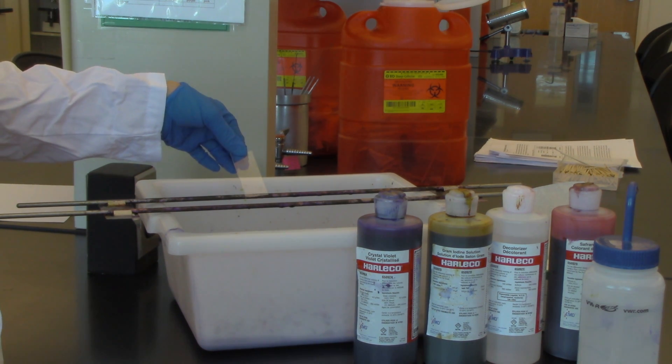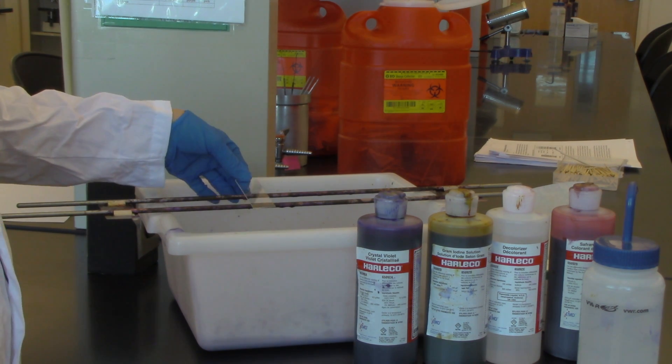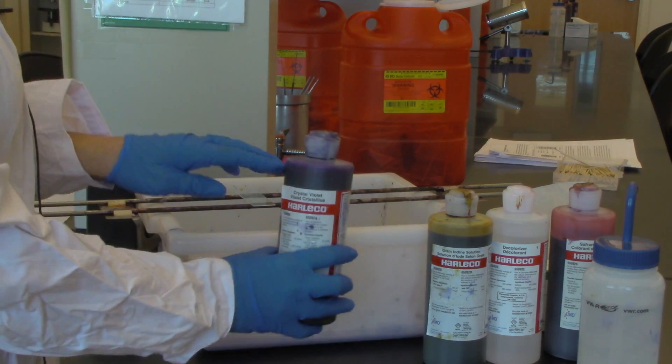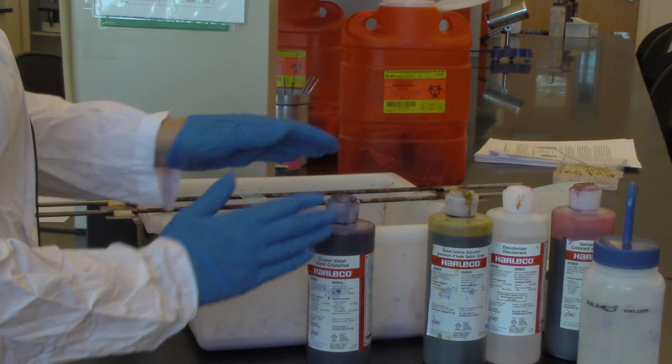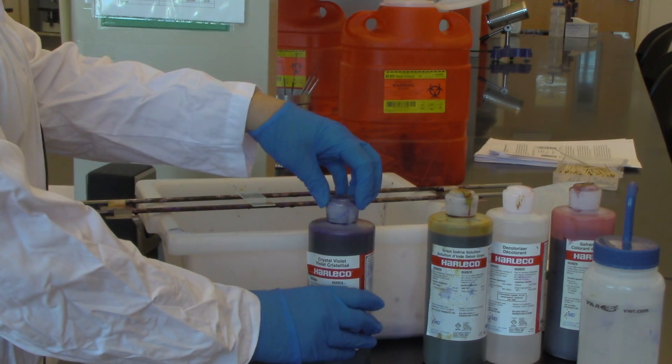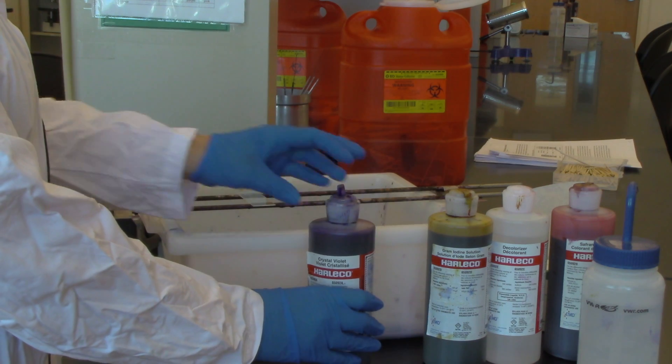You're going to start by getting your slide that has your specimen already affixed to it, and you're going to start with the first dye. It helps to line up the order in which you're going to proceed so that you're not struggling during the timing steps trying to locate the bottle that you need.